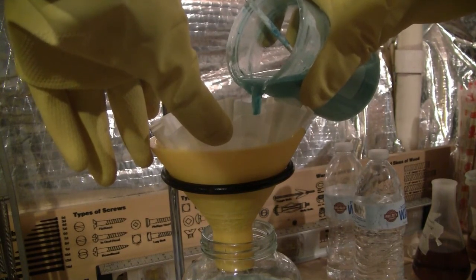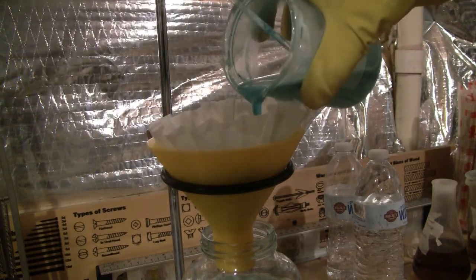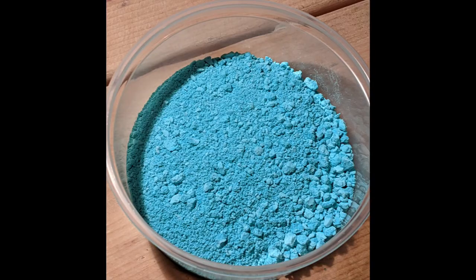I want to note that gravity filtering will take significantly longer than if you do a vacuum filtration. So if you have access to a vacuum filter, I suggest you use that instead. After filtering, the solid is then allowed to sit and dry for a few days, which resulted in a greenish-blue powder.